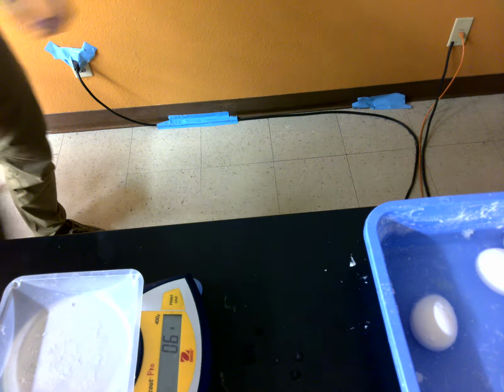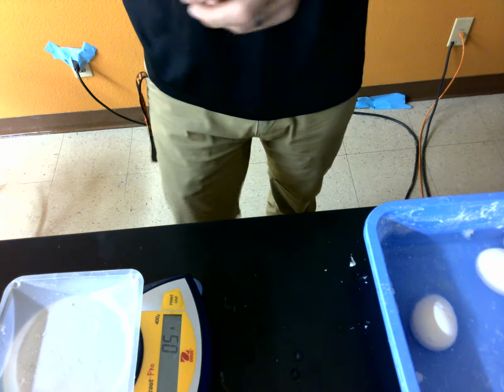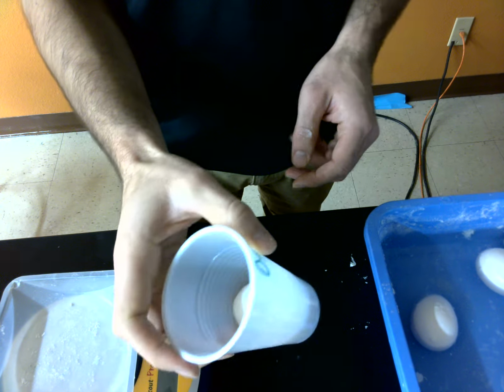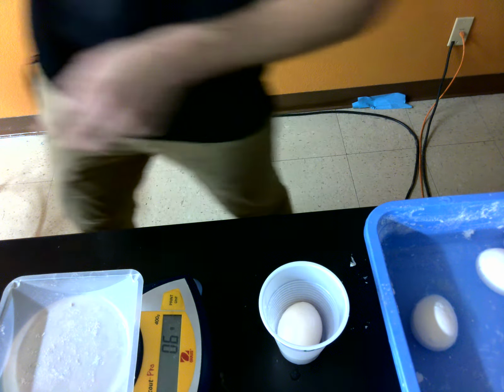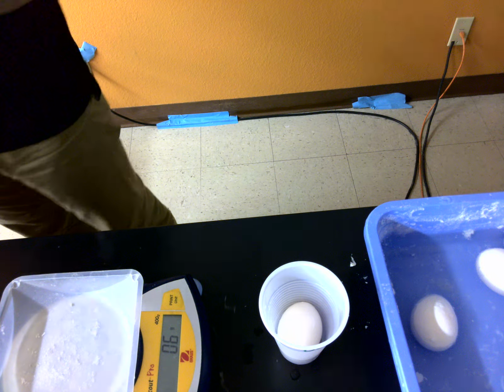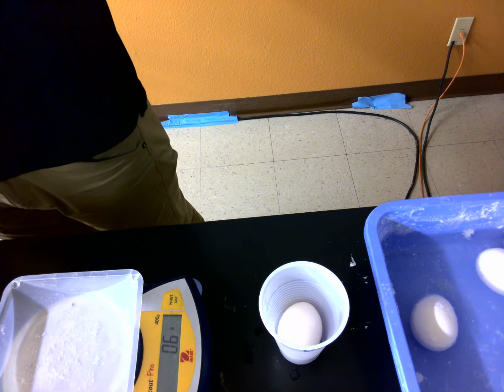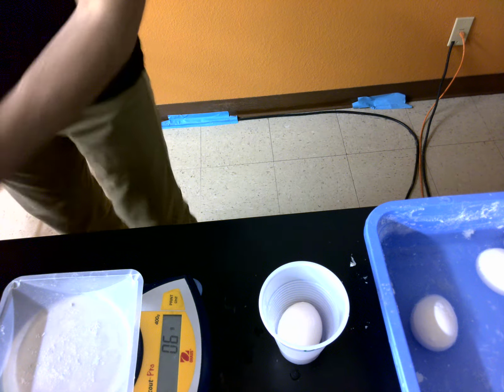Okay, cool. I am also going to do a whole second row of those, so we have duplicates in case any of those eggs break. Now the next thing is we have to fill this cup, so this is the 0, with solution so that it is covered in water. So I'm going to measure out about 100 milliliters of solution.